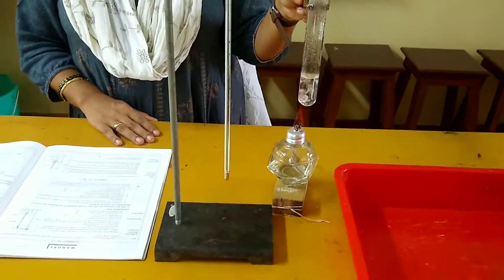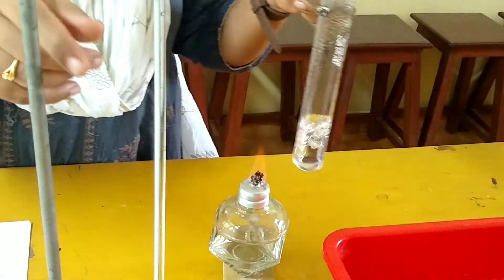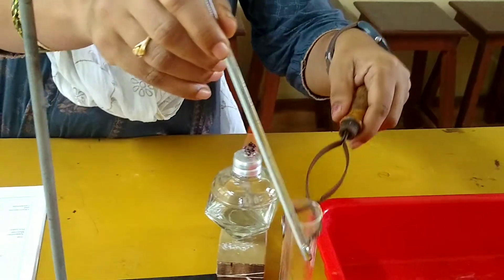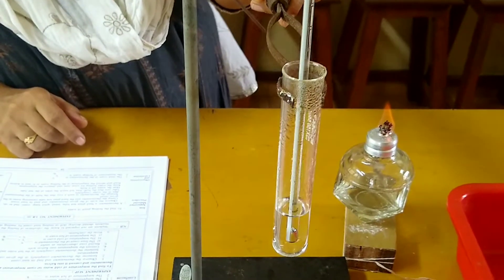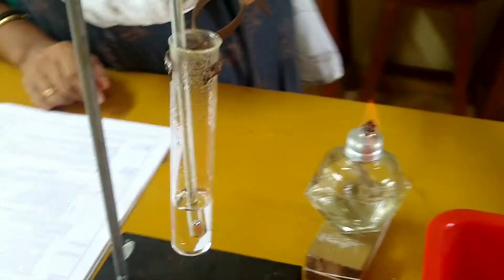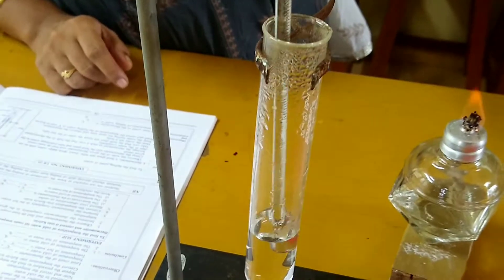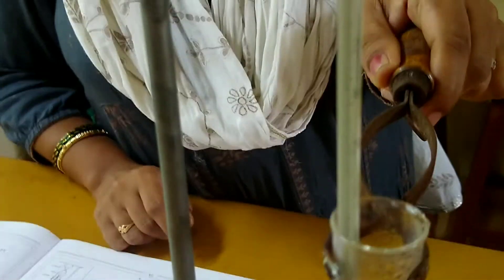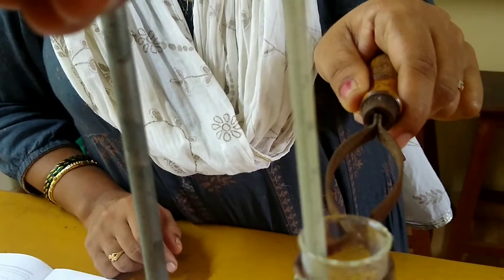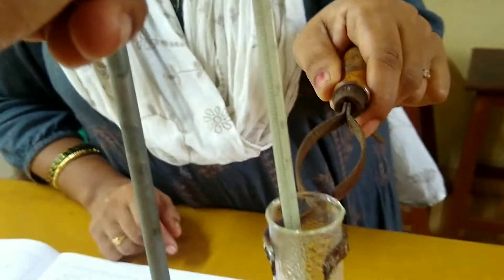You see the water is boiling here, so using the laboratory thermometer when you detect the temperature it comes to 100 degree Celsius. So the temperature of boiling water is 100 degree Celsius.